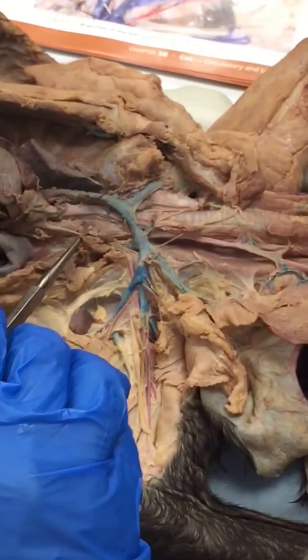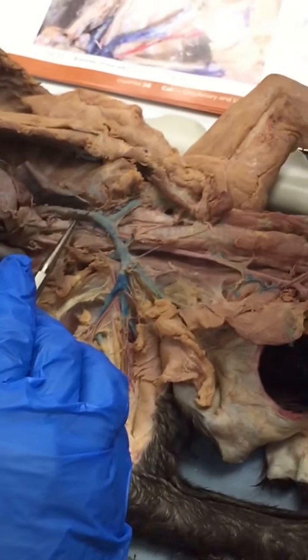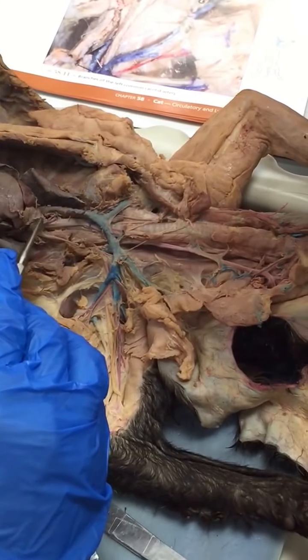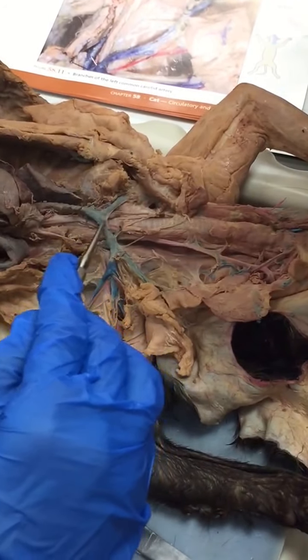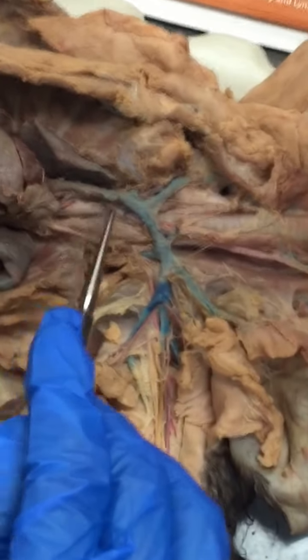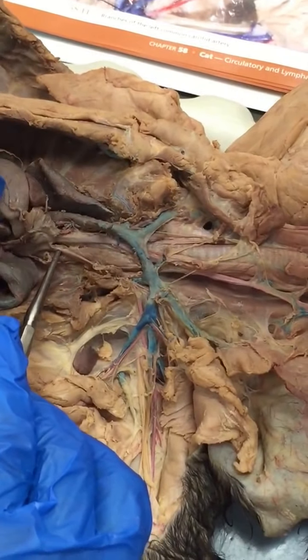So remember that the left and the right subclavian are not symmetrical, right? You've got a brachiocephalic artery on the right side, the cat's right side of the aortic arch, and still a little bit on the left side of the body, or at least central. And then that branches into right subclavian, right common carotid, left common carotid, but then the left subclavian doesn't branch off the brachiocephalic. It branches off on its own further down the aortic arch here, okay?